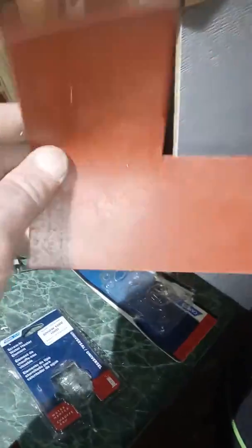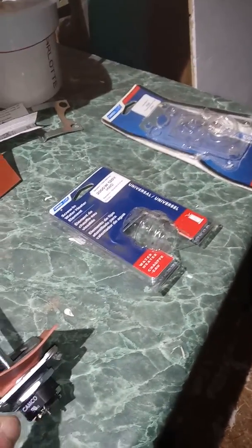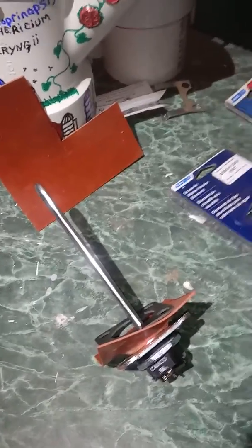I got this piece of rubber from the hardware store, cost me like a dollar. That's what's gonna seal things off — because once I drill holes into the drum I need to be able to seal it so water doesn't leak out. This goes on like this down at the bottom, and this little piece goes on the inside of the drum, so when I put the bolts in, this is on the inside and this is on the outside, and when it seals it should produce a watertight seal.